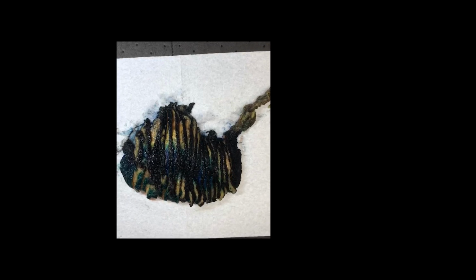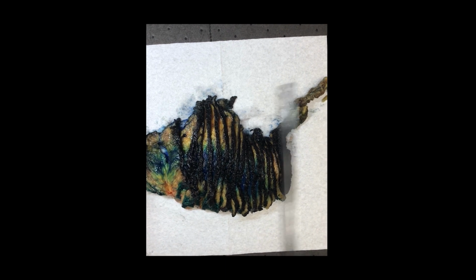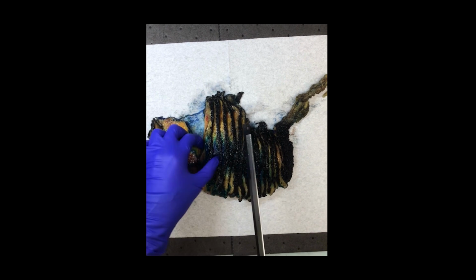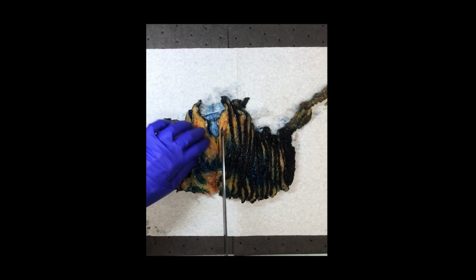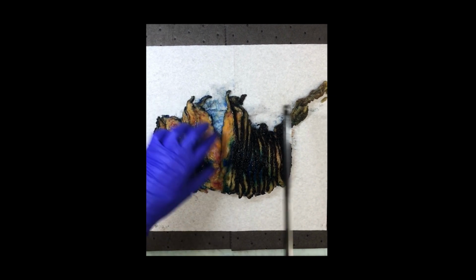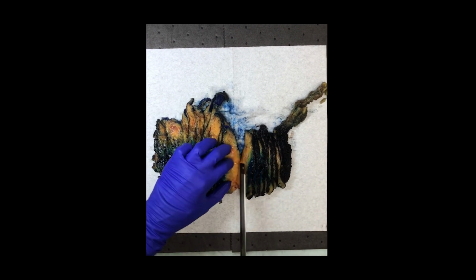So now I'm just going to go back in and clean up all my cuts. I want to make sure that everything's cut fully through to the back of the skin, and that my tissue that's superior and inferior is fully cut through as well. I'm just going through and cleaning up all of those slices. And you can see there, it's cut down all the way to the skin.